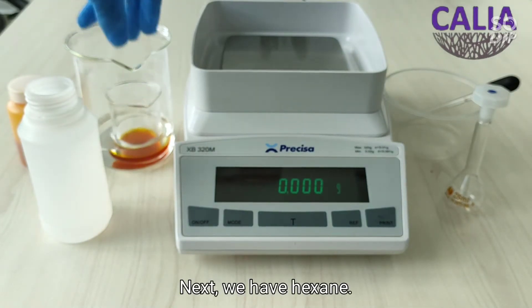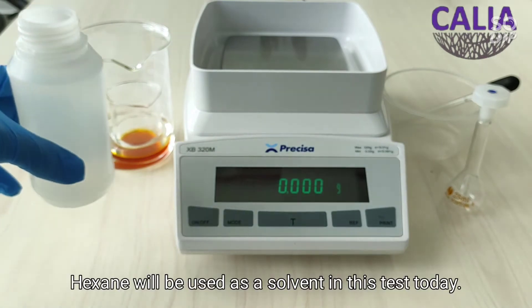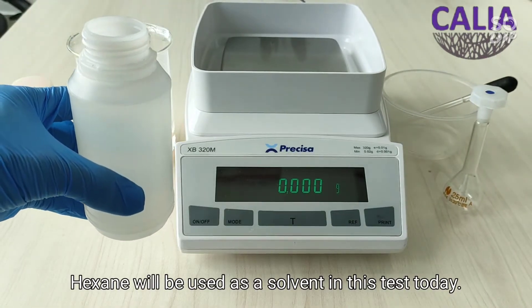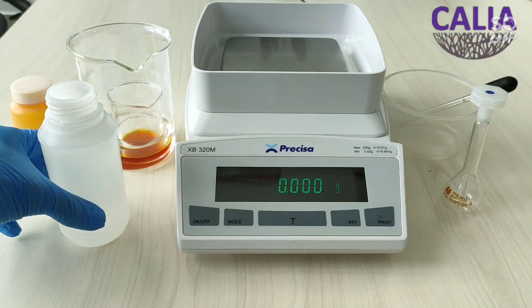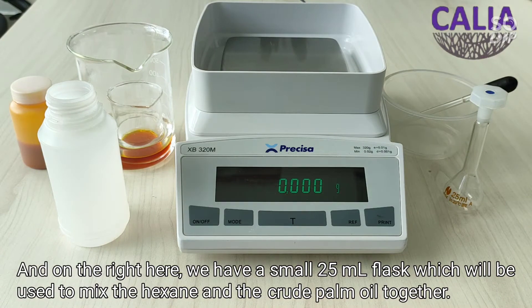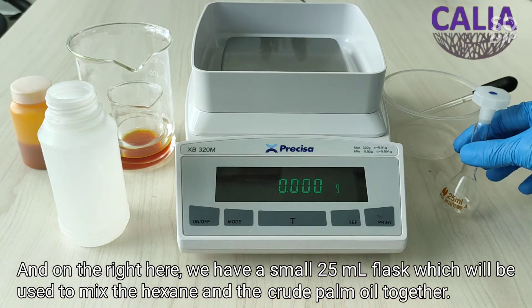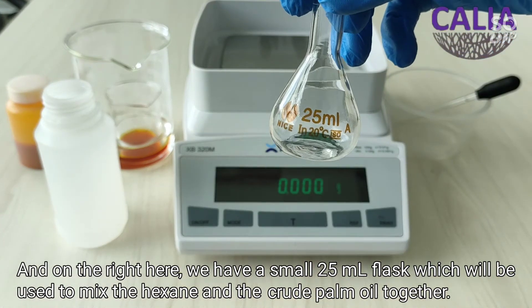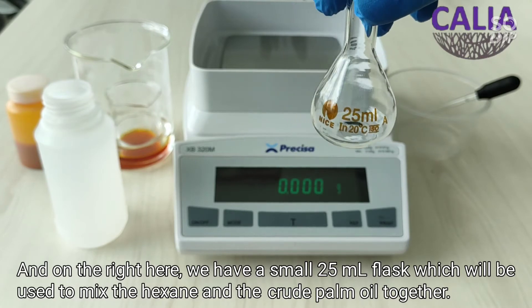Next we have hexane. Hexane will be used as a solvent in this test today, and on the right here we have a small 25 milliliter flask which will be used to mix the hexane and the crude palm oil together.